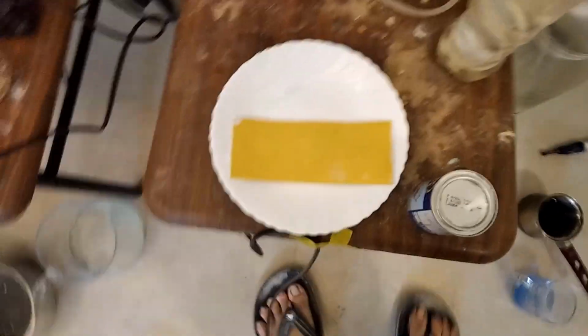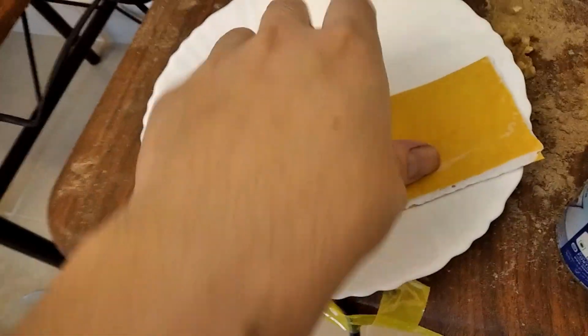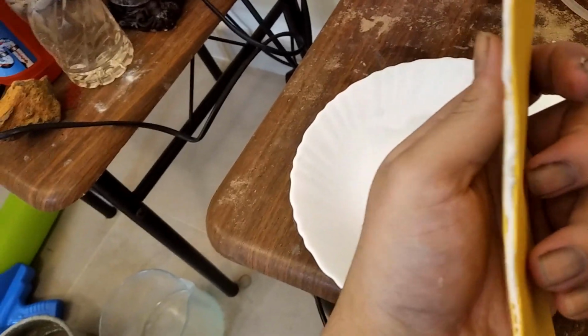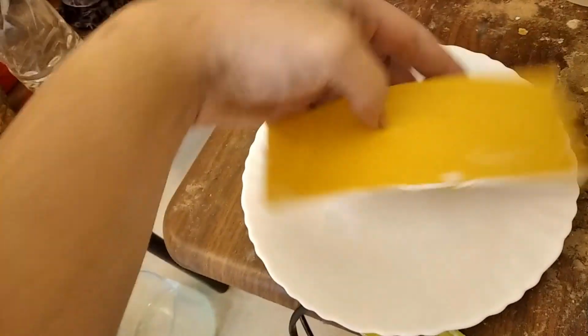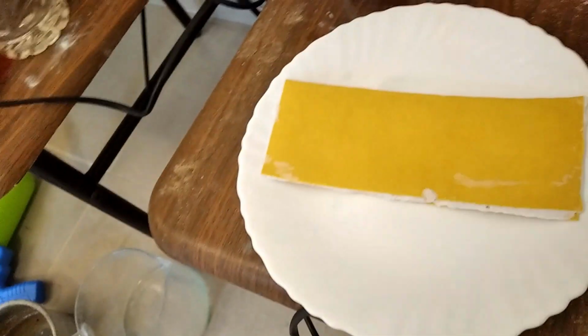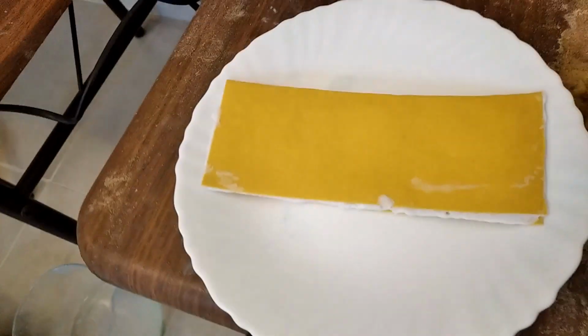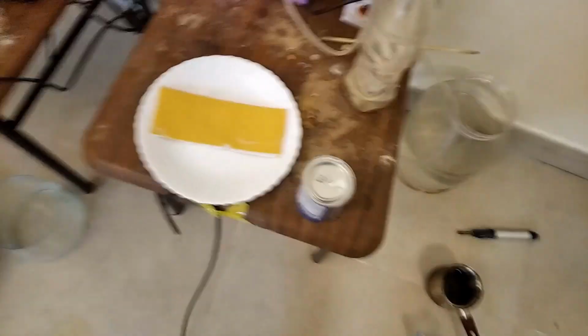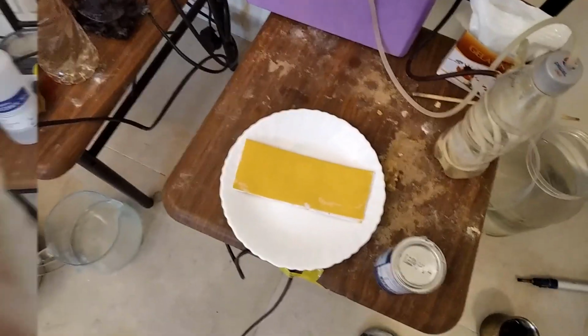let it dry. And once it is dry, as you can see, it is really flat and you have the membrane material in between the supporting scaffold. Once this is dry, you can then fold and put in your cell. And once you put in your cell, you can run anything here. As long as it's permitted, it does not degrade. Unlike gelatin, this is much better.